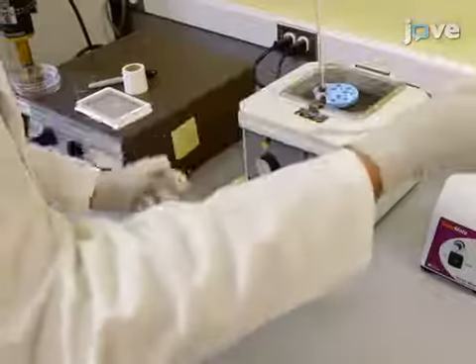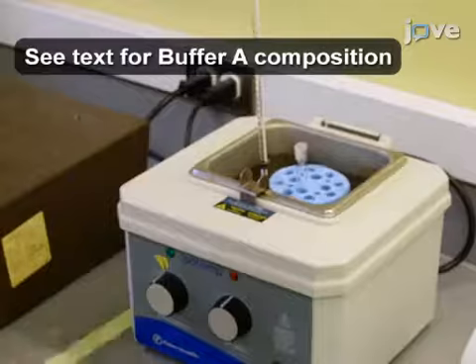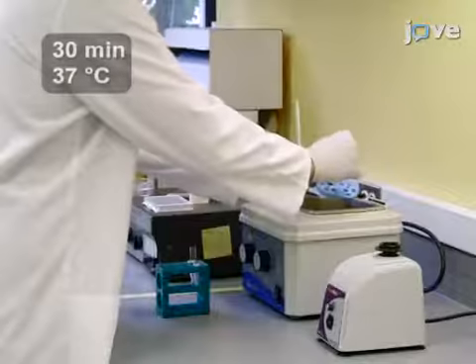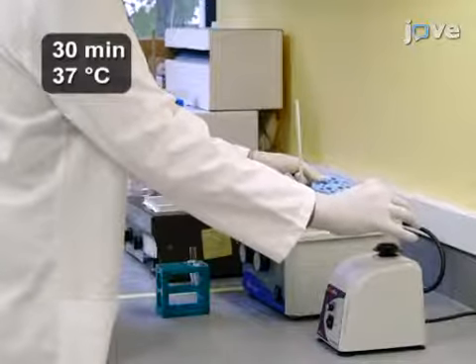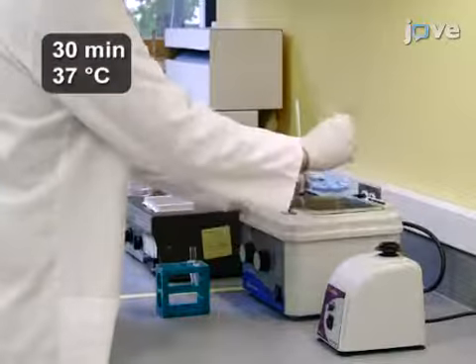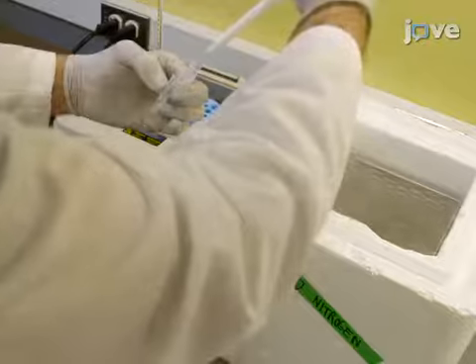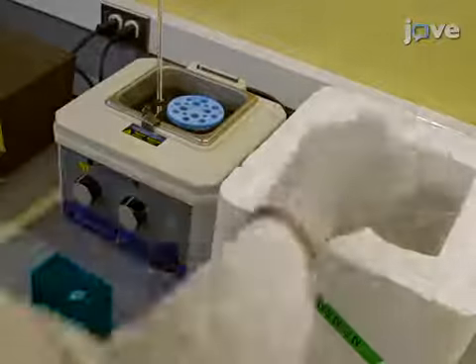Following this, add preheated buffer A to give a final lipid concentration of 1 to 2 millimolar. Incubate for 30 minutes at 37 degrees Celsius with occasional vortexing to fully resuspend the lipid mixture. After incubation, transfer the lipid mixture to a plastic test tube and place the tube in liquid nitrogen for approximately 30 seconds until completely frozen.